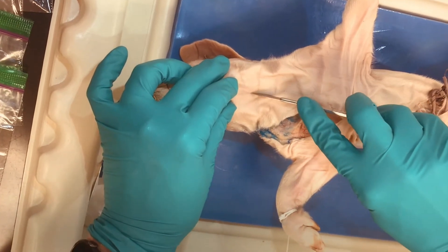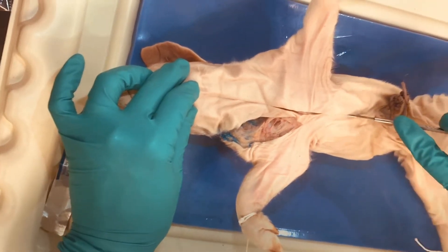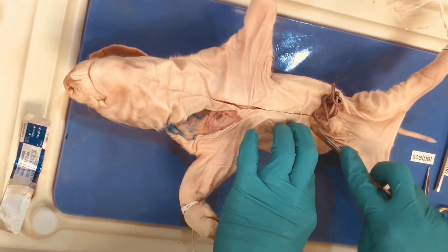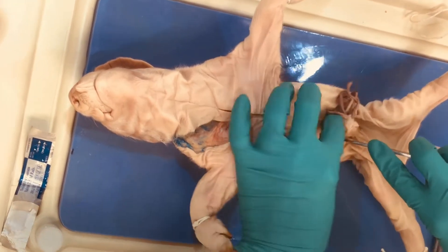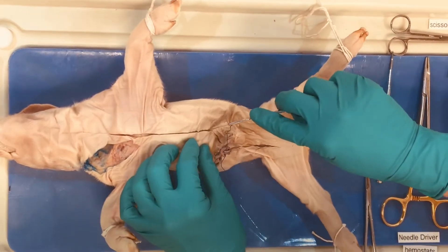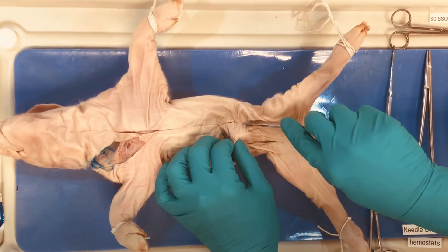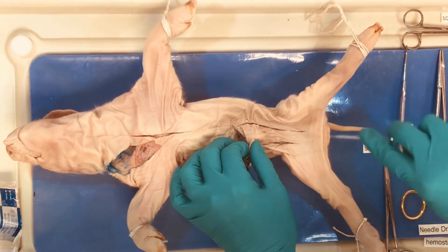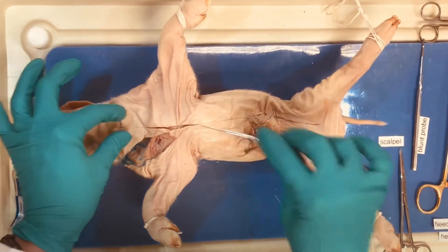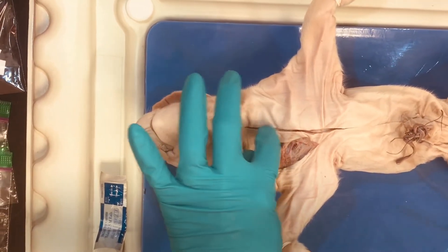I'm going to gently cut through the skin and extend my incision down towards the umbilicus. When I get to the umbilicus, I'm going to make a skin incision around the sheath, providing a flap of tissue that we can retract the sheath and keep the penis intact. We'll do this for the female as well because you have to go around the umbilicus and there are some umbilical structures we're going to want to look at. As we've made this incision, you can see I've gone all the way through the skin and now I've got tissue to move through.